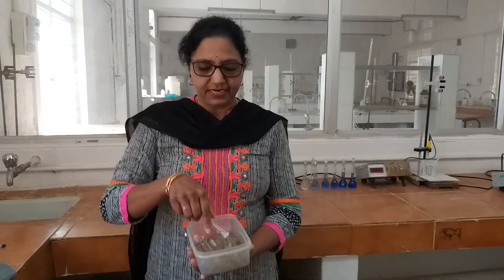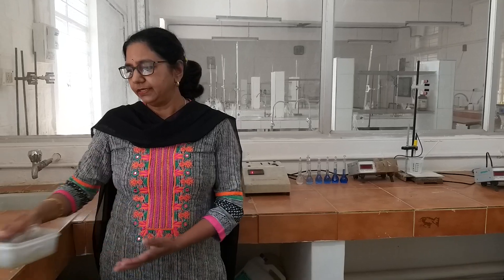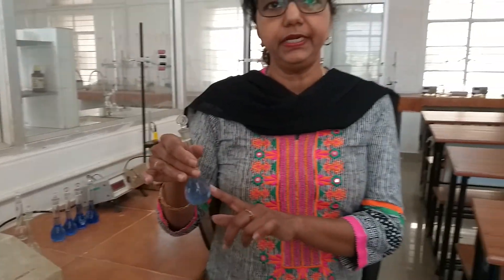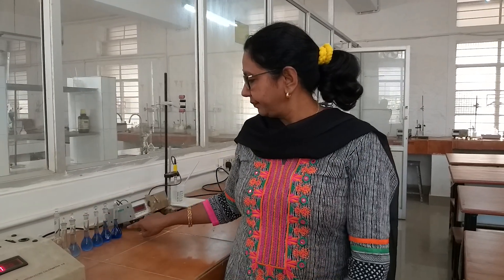For doing this experiment, we need these volumetric flasks — 25 ml flasks. We have to prepare solutions taking copper sulfate in varying volumes: 5 ml, 2.5 ml, 7.5 ml, 10 ml, and 12.5 ml. To each volumetric flask containing these varying amounts of copper sulfate, we will add 2.5 ml ammonium hydroxide and then make it up to the mark. I have prepared a series of copper sulfate solutions: 2.5, 5, 7.5, 10, and 12.5 ml.